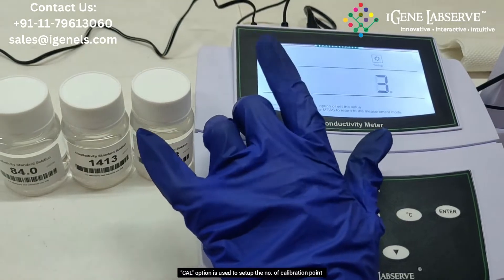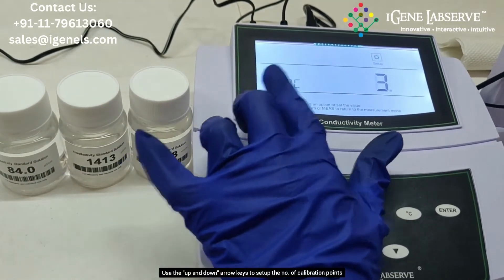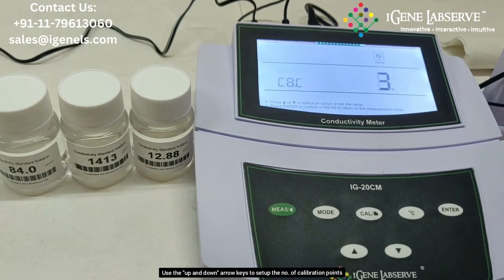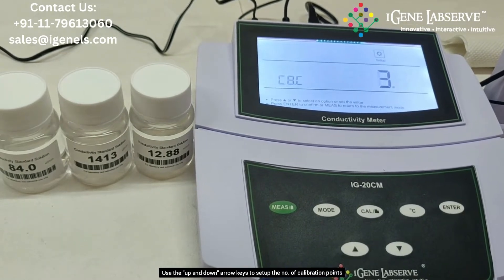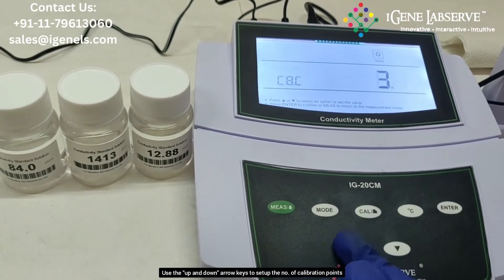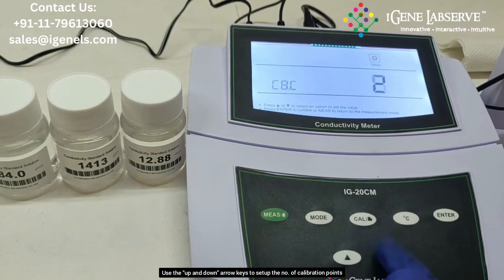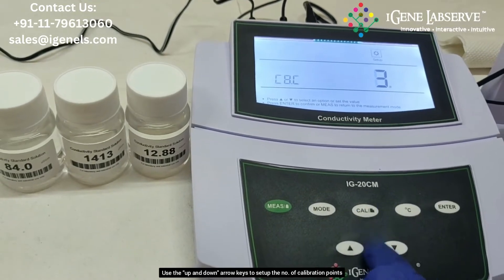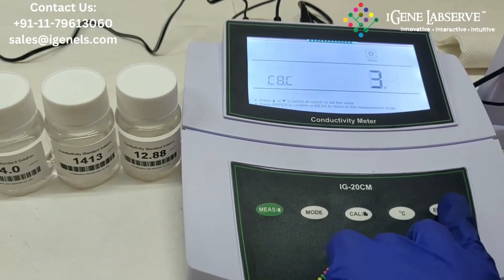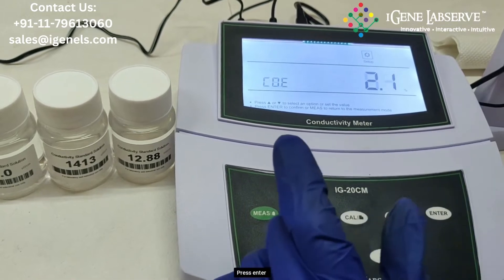The second parameter is the calibration points. You can set ranging from 1 to 3 calibration points according to the buffer you are using for calibration. Switch between 1, 2, and 3 calibration points using the up and down arrow keys, then press enter.